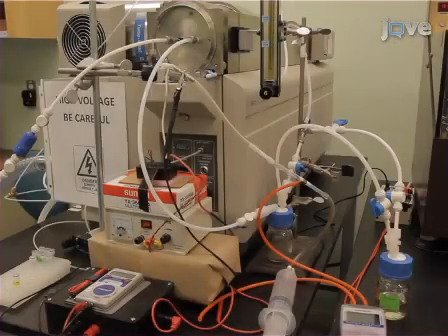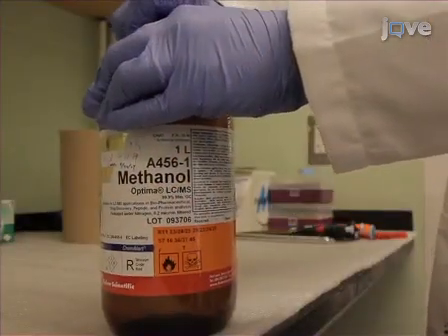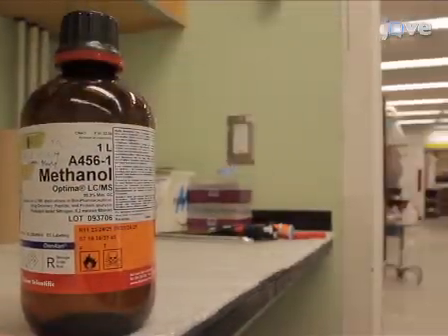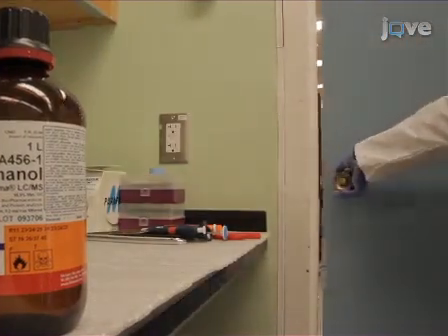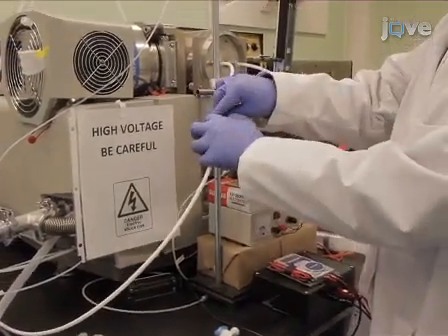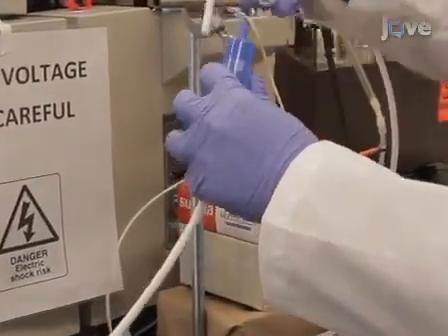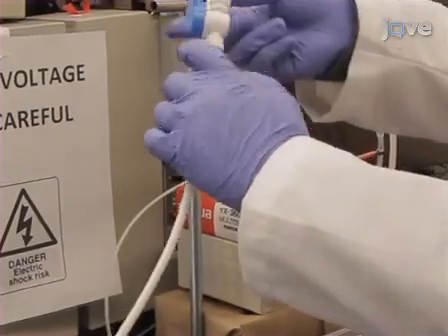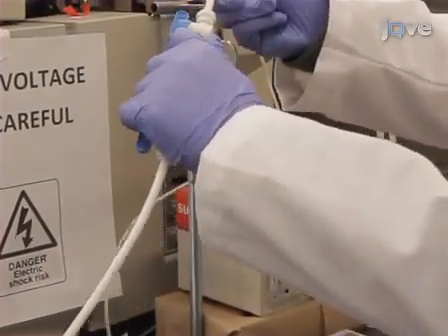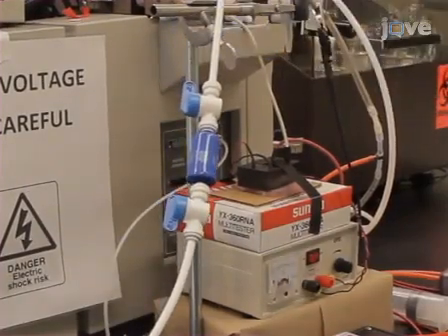Since the SESI-MS is specifically designed to sample volatiles, limit the use of fragrant personal care products before using the instrument. Tightly cap all volatile chemicals in the lab and control air drafts as much as possible during testing. To prevent contamination of your instrument and the gas transfer lines with viable biological agents, install filters of the appropriate pore size into the carrier gas line.